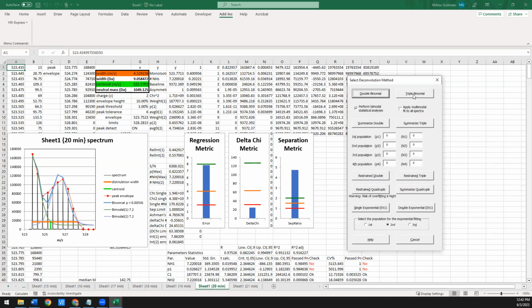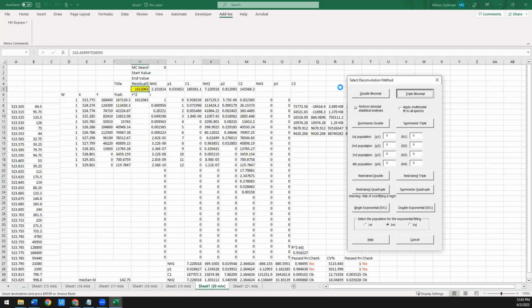It's kind of risky in that you're entering the realm of potentially overfitting because you'll have so many parameters that you may not even have enough data points to justify using that many parameters. But in some cases, this might potentially give you some more insight into what might be happening in your data. So we're going to try a triple and see what it looks like.